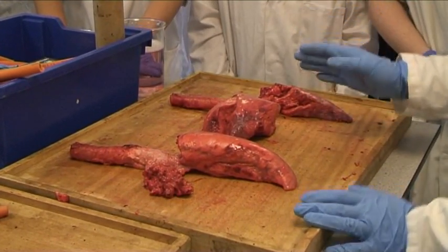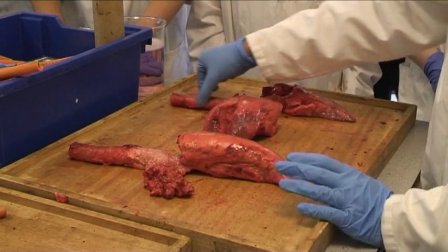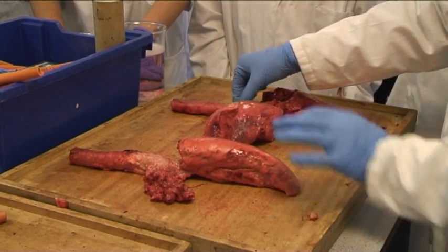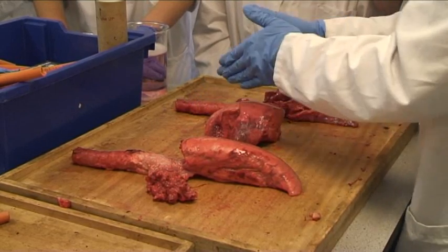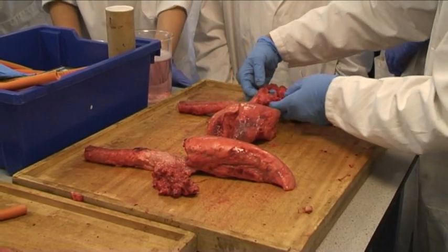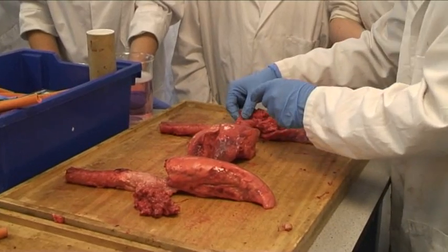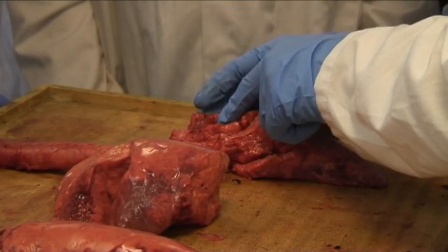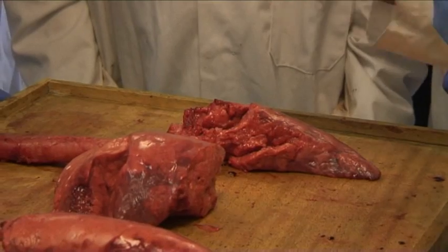Watch before you touch anything — this is a demonstration of what one of the previous students has dissected, and it's a fantastic dissection. You can see the trachea, and the diagram on there explains it as well. You've got the trachea, which then splits into bronchi — the separations that go to each lung — and then the smaller tubes coming off the bronchi, which are the bronchioles.